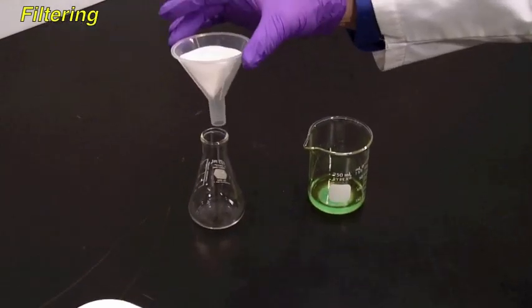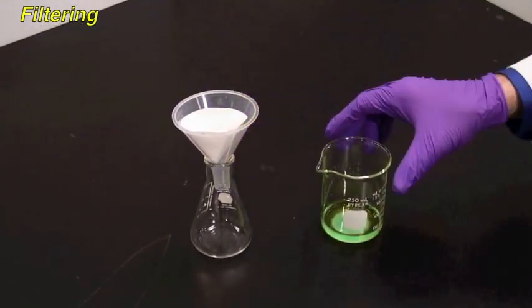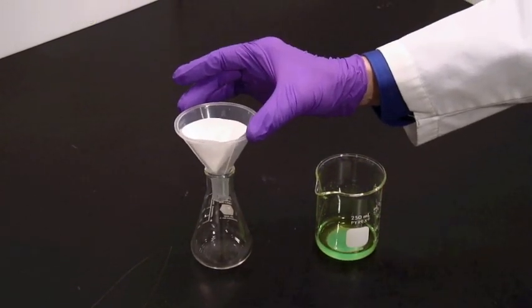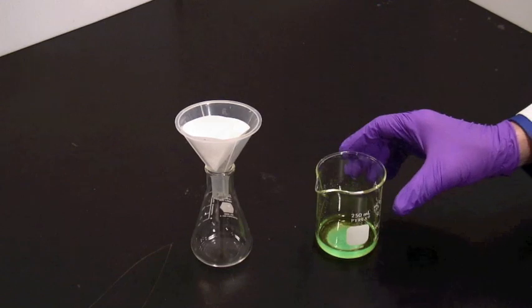You'll need to have your funnel sitting above a receiving vessel. I'm using a flask here. You can use a beaker. Sometimes you may need to support this with a clamp, but usually it'll just sit in the neck of the vessel.